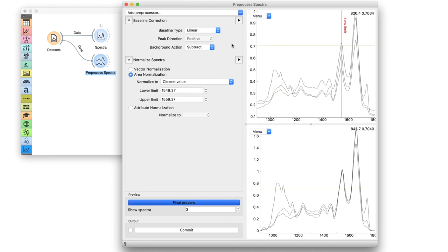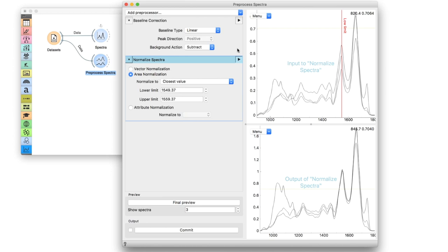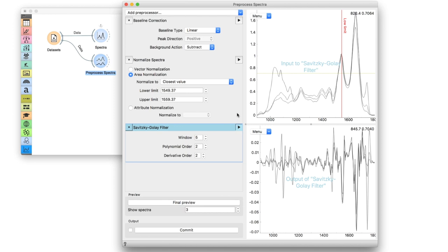To observe the effects of just one preprocessing step, I can click on the triangle next to the preprocessor and see how the plot changes. Finally, we will use the Savitzky-Golay filter to calculate second derivatives. This is a commonly used procedure to accurately find peak positions or remove low-order data variation, such as baselines. The result looks completely different from the input data.